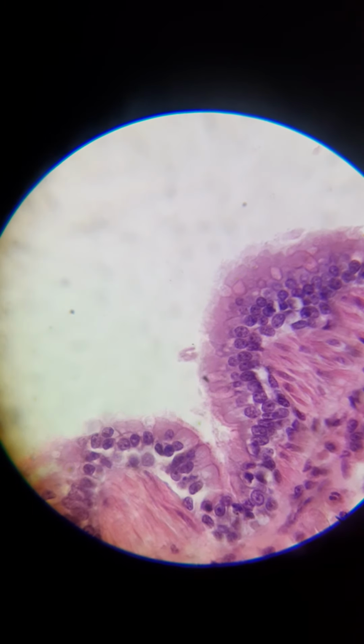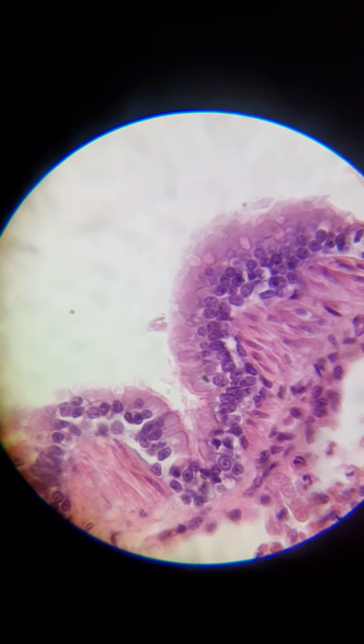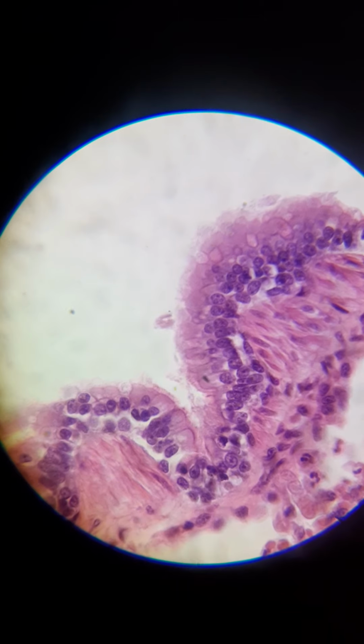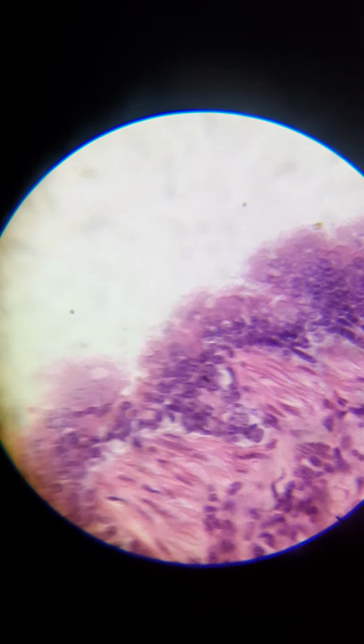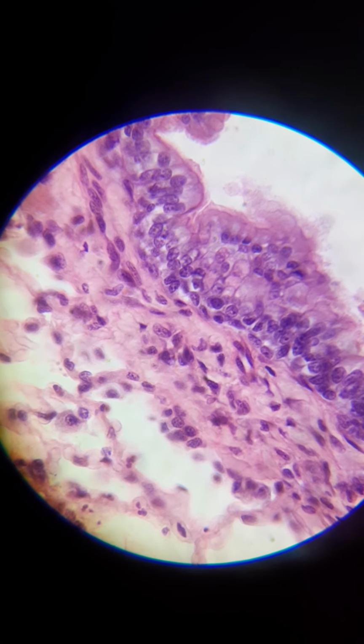Maybe I can use that as a marker. So if I put it right here, you see these little segments. Man, that is not showing up very good. All right, I'm actually going to look for a different spot because I don't think that's going to work very good.